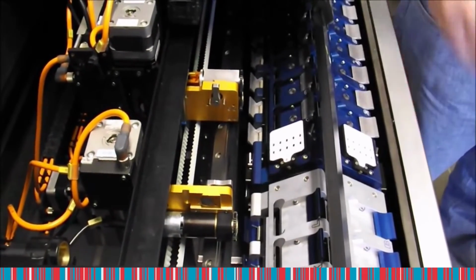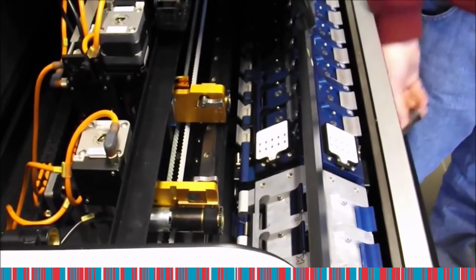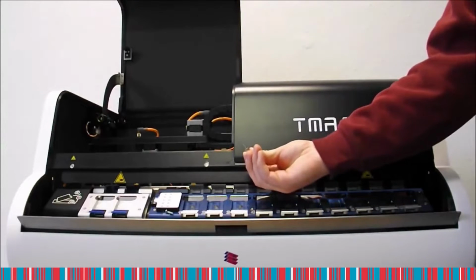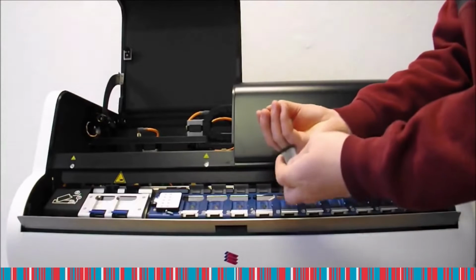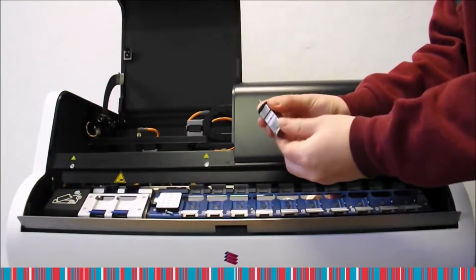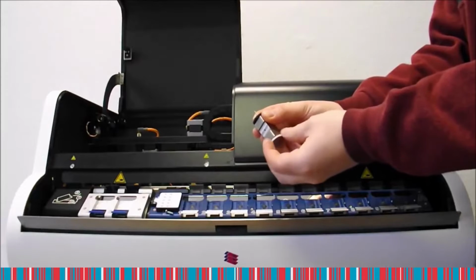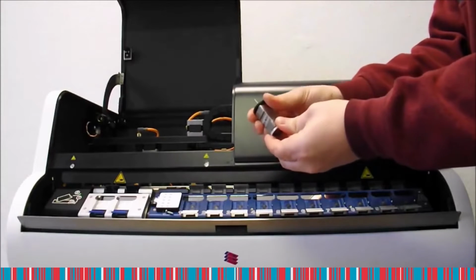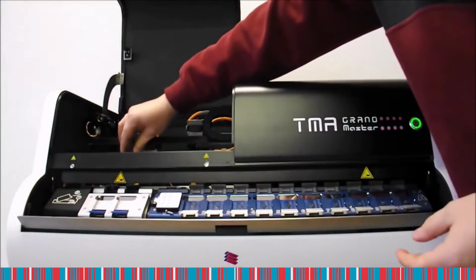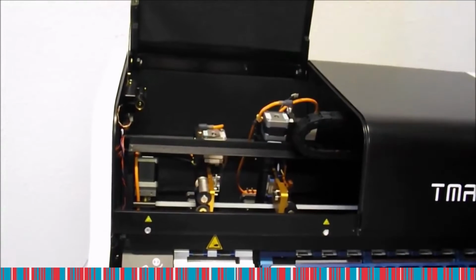First remove the driller chuck. Then you can also remove the puncher chuck. Insert tools in the chucks. First, insert a driller in the driller chuck. If the driller is in its place, tighten it. When you feel that it's tight enough, you can put back the chuck with the driller in the machine. Don't forget to fix the chuck with the lever.